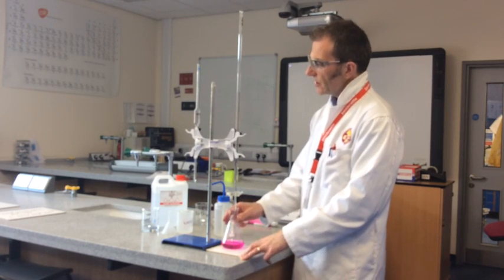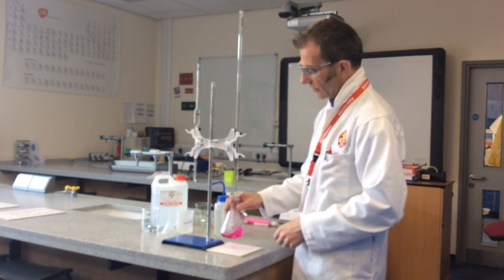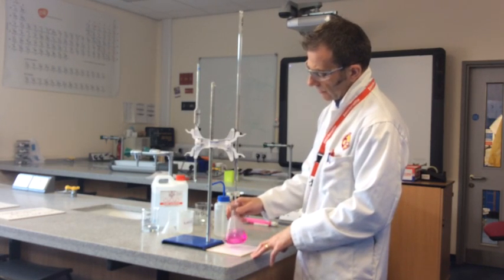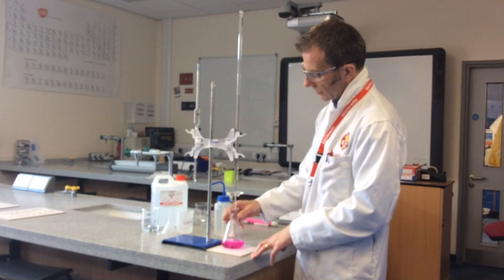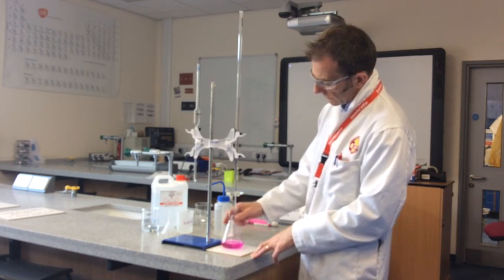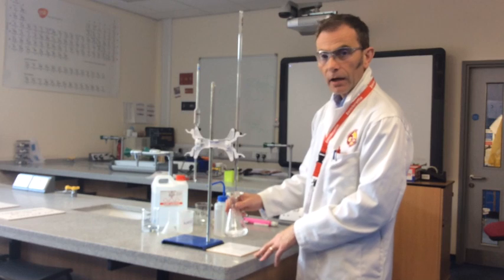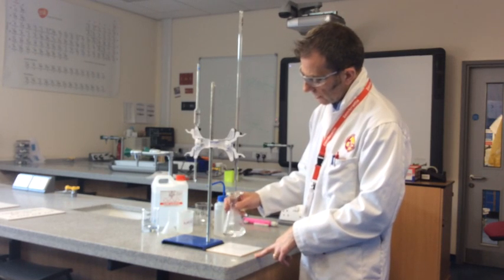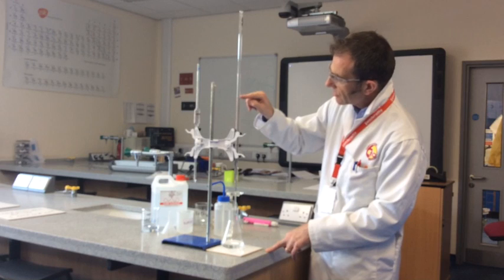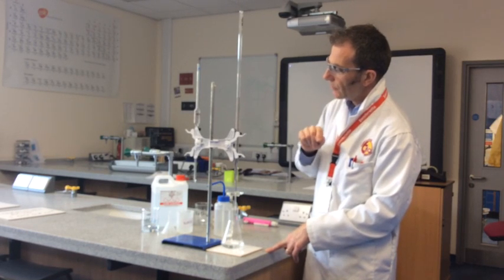So we're going to keep adding until something happens. So I'm on 22 now. It's still pink. We'll put another one in. 23 now. Nope, still pink. Is it ever going to go? 24. It's gone. Right. So that means that the end of this titration is somewhere between 23 and 24.